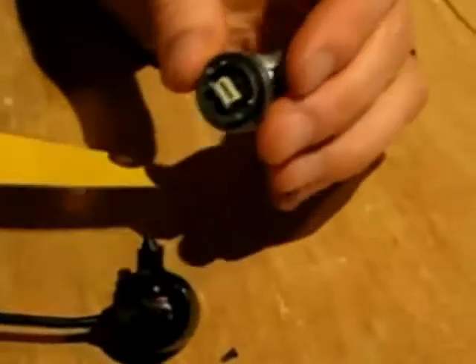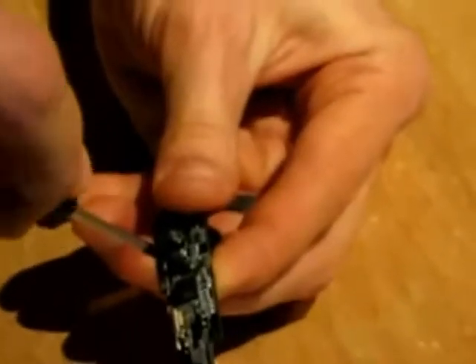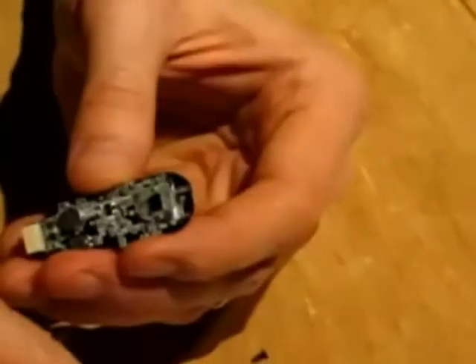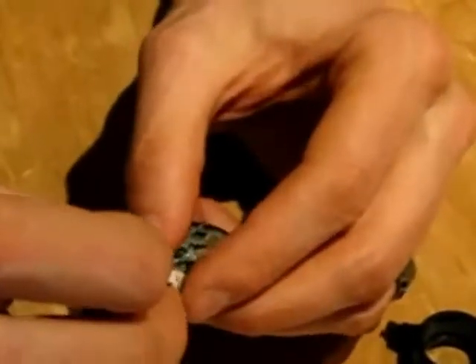We are making a microscope out of a little webcam. First we take the webcam apart. The lens has to come off too. This is the sensor. We are plugging the USB cable back in.